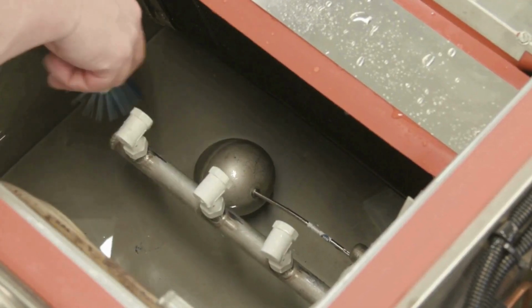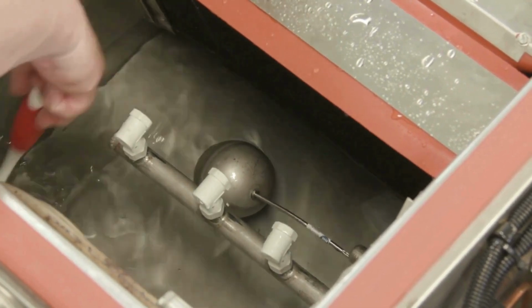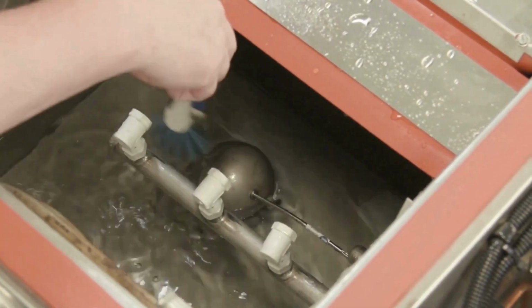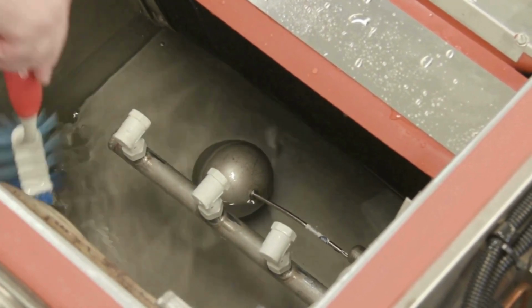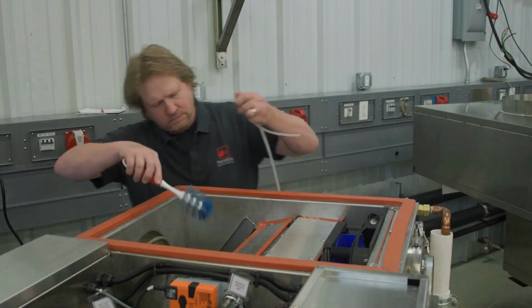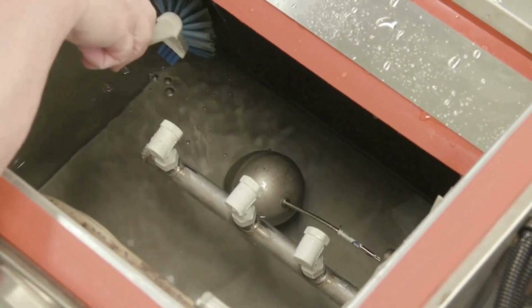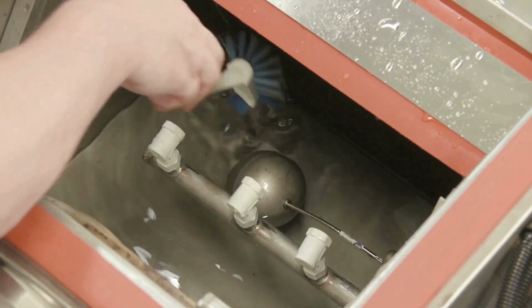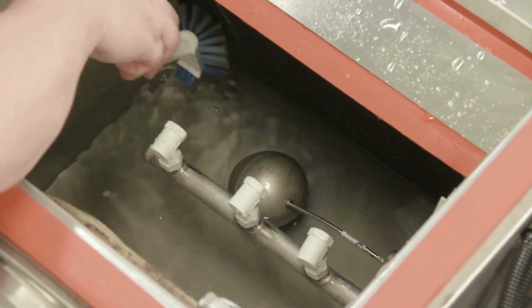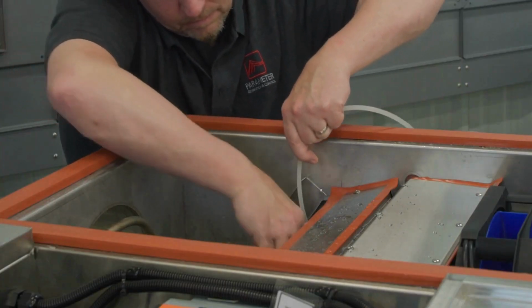Clean all of the sump surfaces and the internal parts as necessary. Clean the fin evaporator coil, being careful not to fold the fins. Remember that the coil can be blocked between the fins and still look clean on the surface. Pressure washing is typically the only effective way to get the gunk from deep between the fins.